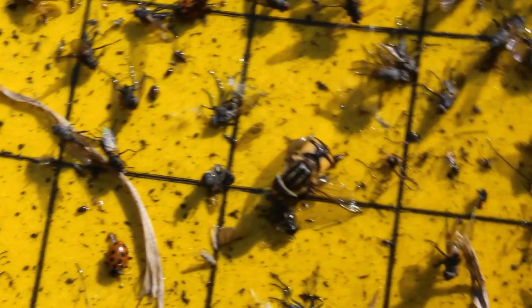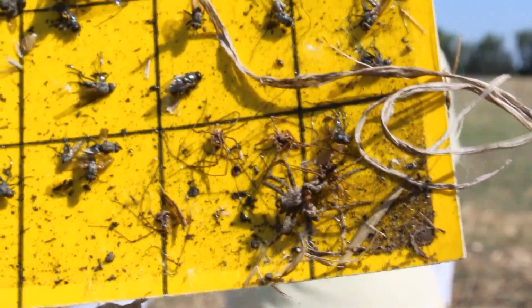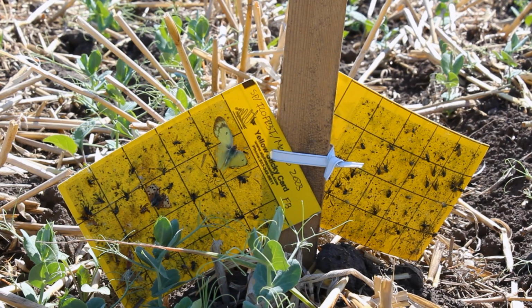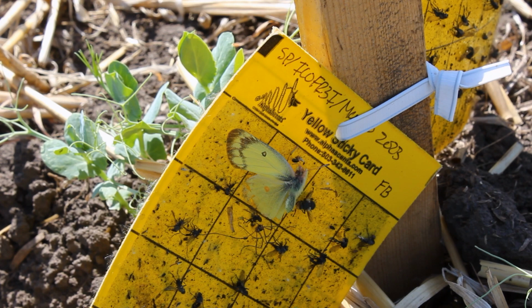We kind of went over all the traps and what we're doing for one trap location, but we also have a second trap location 25 meters into each of the treatment plots. So we'll essentially be having an interior trap and an edge trap. And we'll also be comparing the insect communities that we find in the edge and the interior, as that can definitely have an impact on what we're finding.